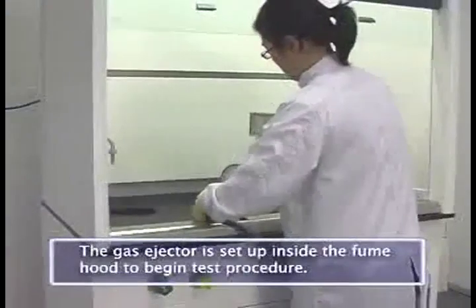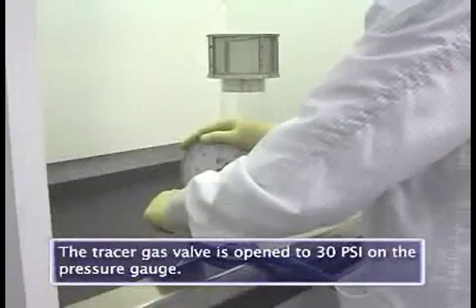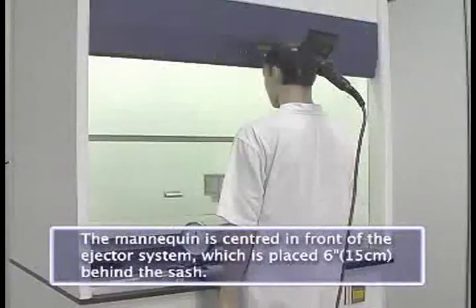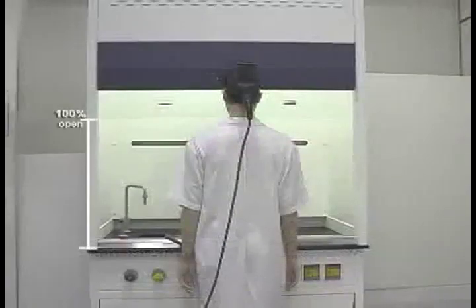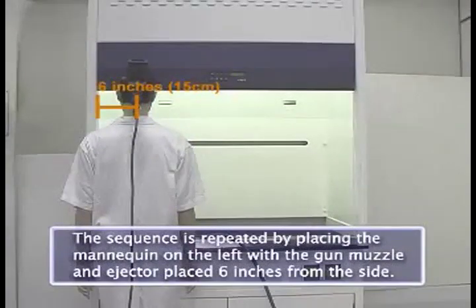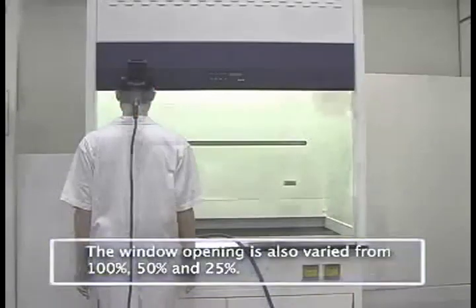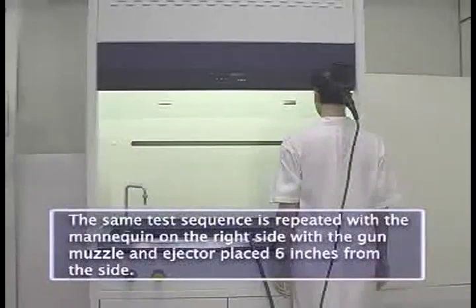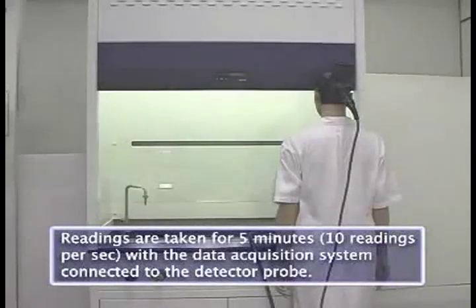A gas ejector is placed in the fume hood 150 millimeters behind the sash, and tracer gas is released at 30 pounds per square inch. A mannequin containing sensor equipment is placed in front of the hood, three inches from the front of the sash window. Readings are taken with the sash open to 100%, 50%, and 25%. The test is repeated with the center of the mannequin and the gas ejector placed six inches from the left-hand side of the cabinet, with readings taken at different sash heights. The sequence is then repeated on the right side of the cabinet. Readings are taken for five minutes using a data acquisition system connected to the mannequin and are analyzed.